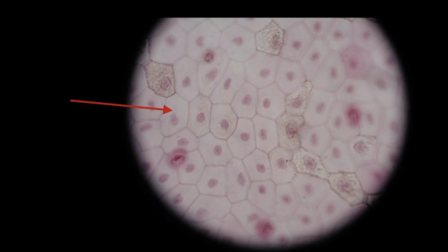Okay, so I want you to always pay attention to count how many nuclei are in the cells, count how many nuclei you could possibly fit in a cell, and notice the shape of the cell, notice the color of the stain. These things you want to pay attention to. So right off the bat, I see that we've got pinkish. It looks like we have 6 sides, 5 sides for each, kind of like a soccer ball patch, and it looks like we can fit maybe 10, maybe 15 of these nuclei per cell. So this will come in handy as we go on to our future tissues.